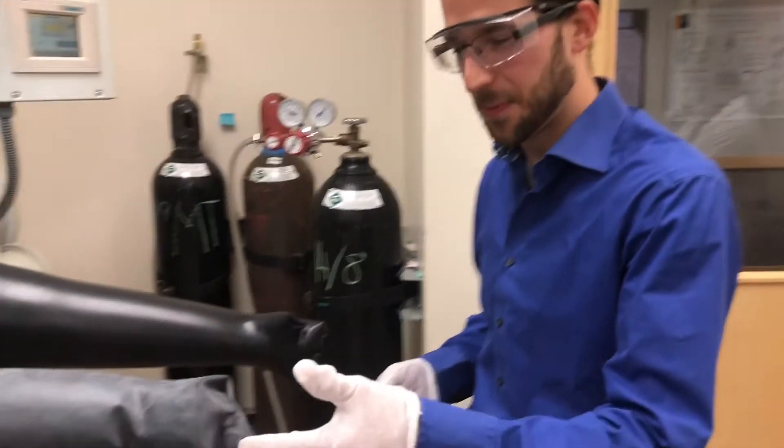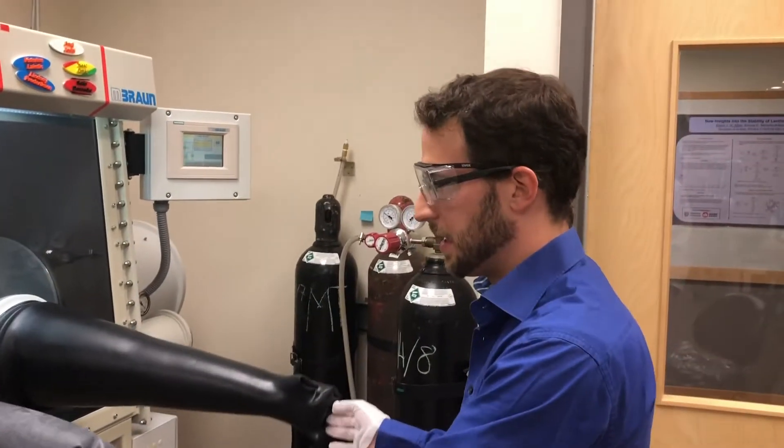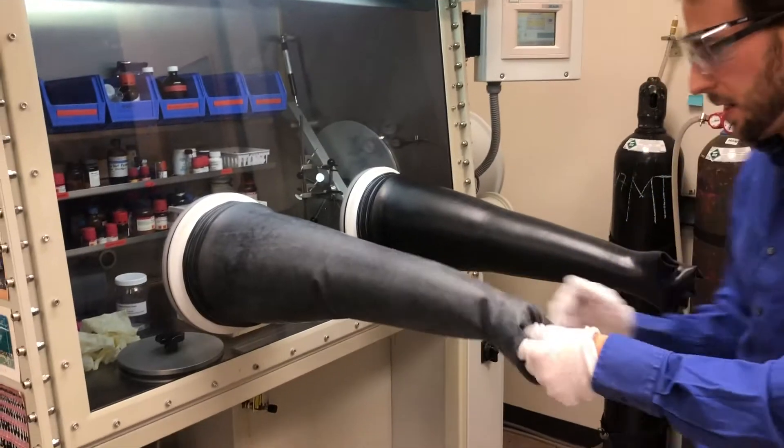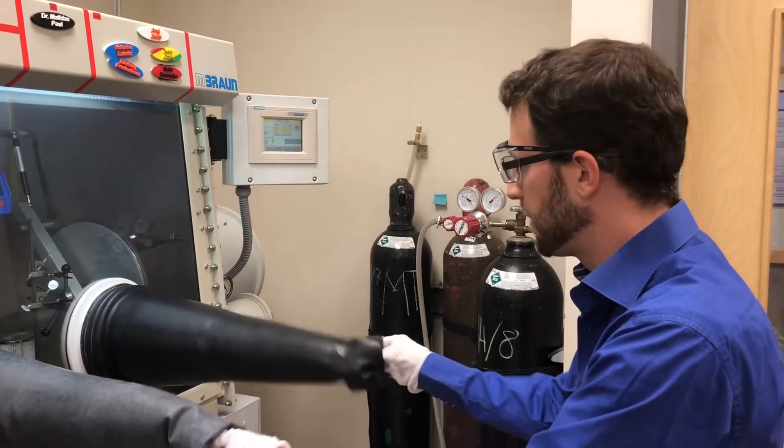Hello! Today I'm going to show you how we change the gloves on the glove box. So we already did this one previously. You can see it's still a little bit white from the powder. This one here is used for a long time.